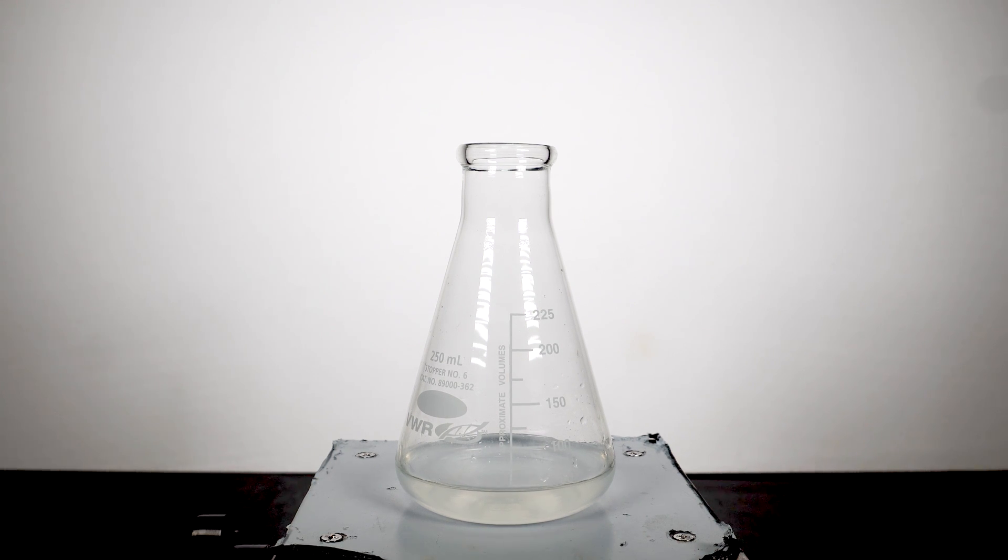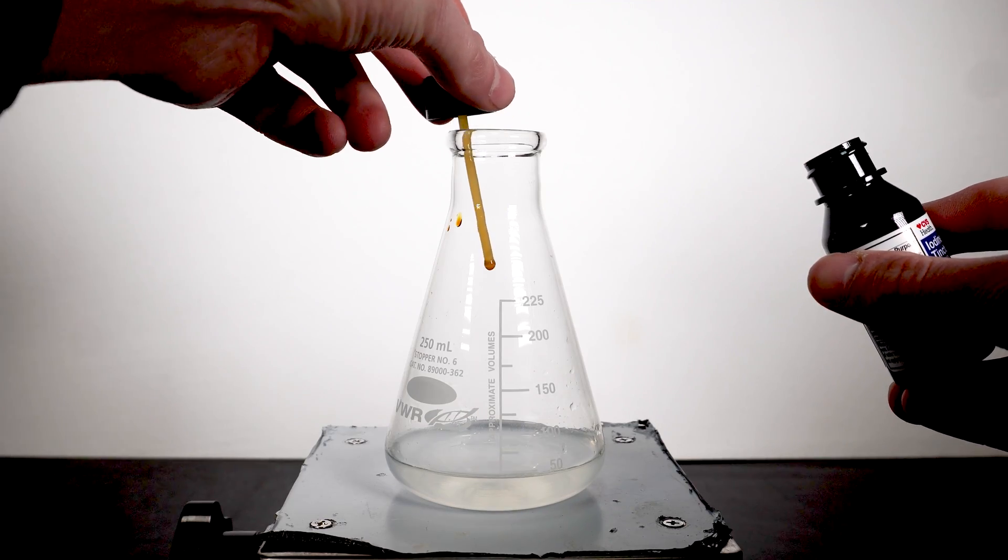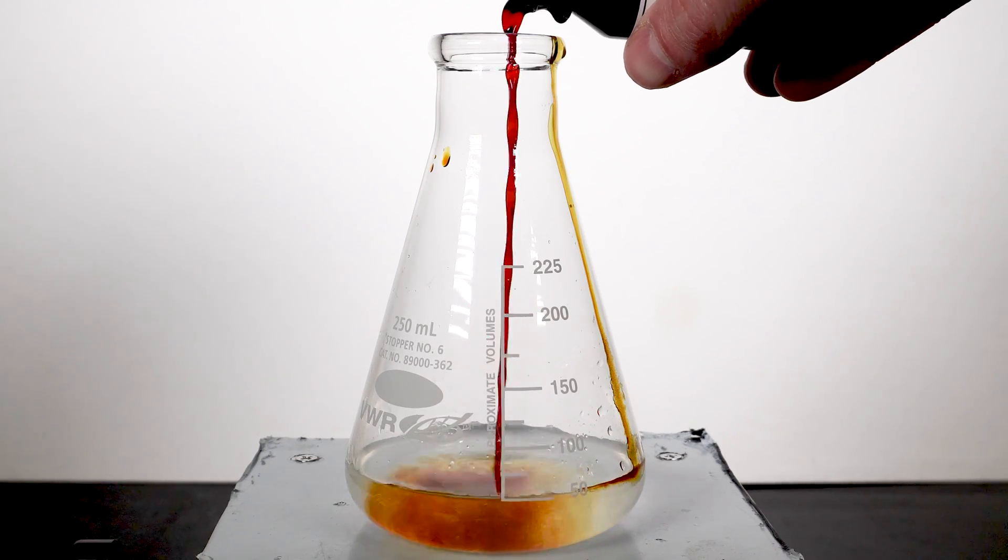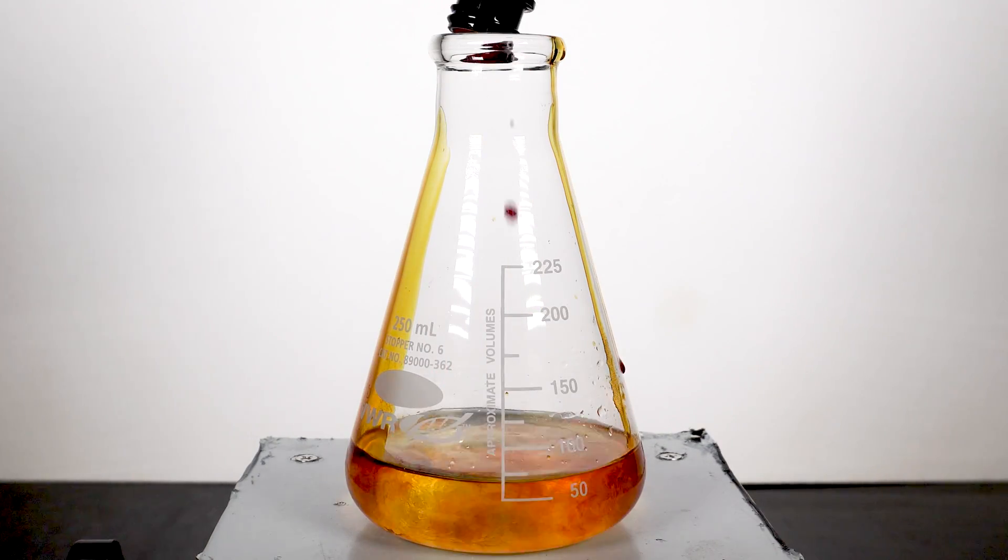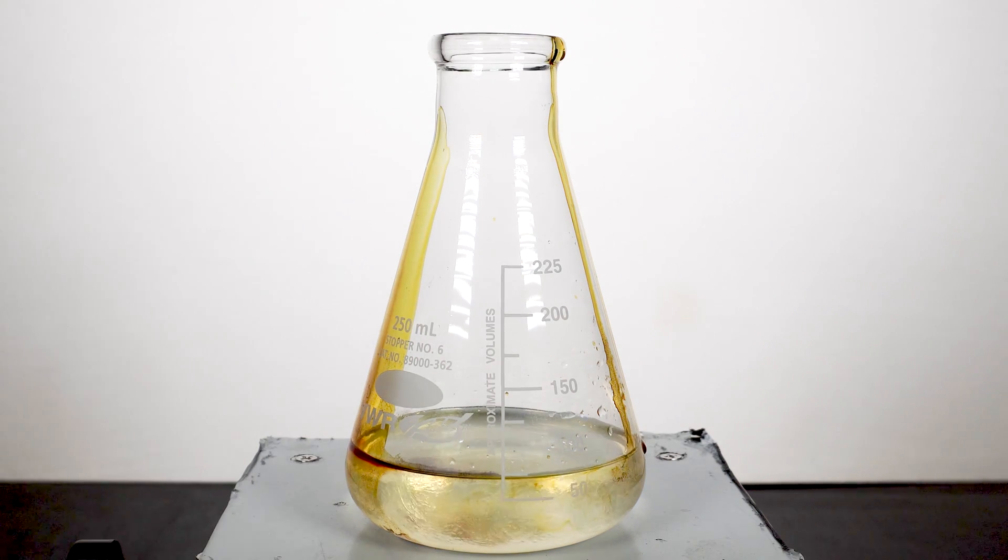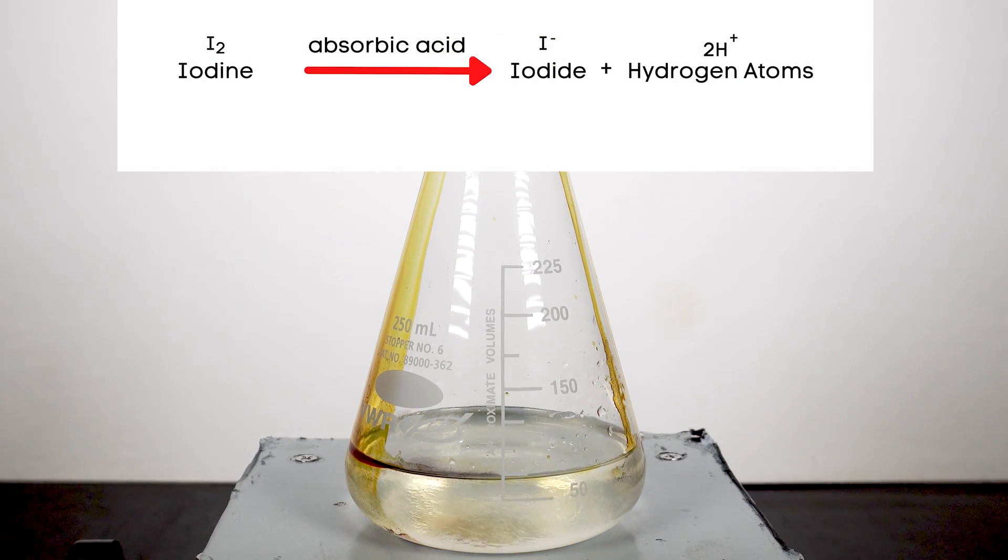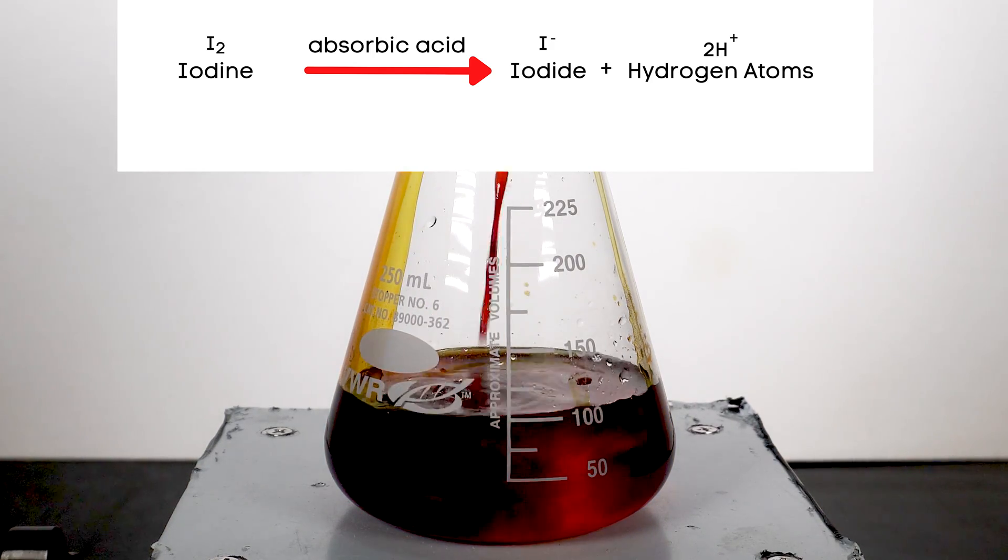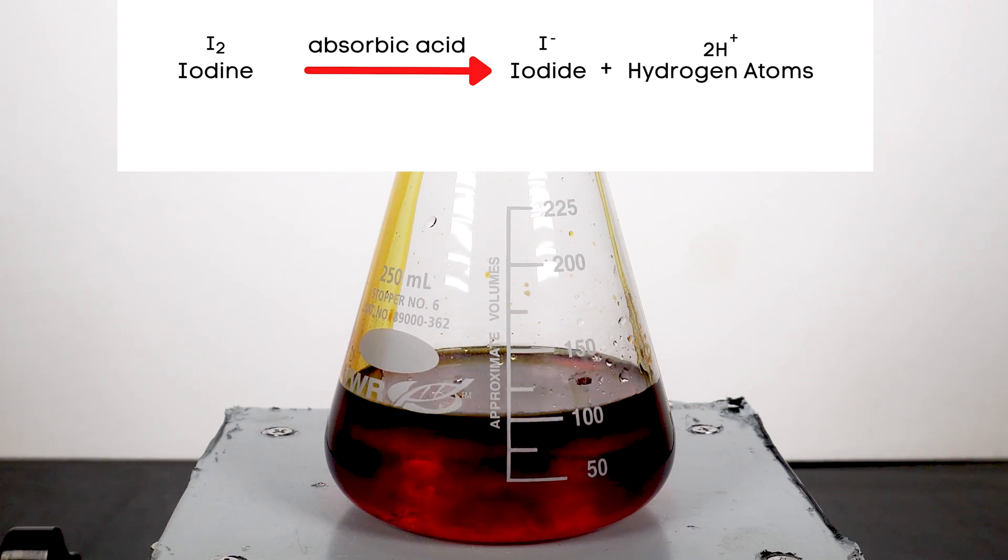The next thing we'll need to do is get out our bottle of 2% iodine tincture, and we just pour in the entire bottle. As we add in the iodine, we can see the tincture go from brown to colorless when it hits the ascorbic acid solution. What is happening here is the vitamin C splits up the I2 ions into I- ions. The natural state of I- or iodide is colorless. Well, I2, or iodine, is actually purple, but it comes out brownish, and that's the color we usually associate with iodine. This only works, though, if we have an excess amount of ascorbic acid.